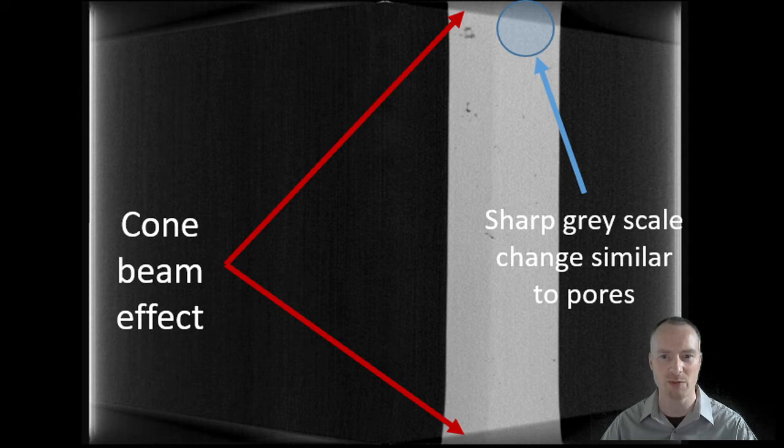The cone beam effect will be made worse as the X-ray detector moves towards the X-ray source, and it will decrease as the X-ray detector is moved away from the X-ray source. The cone beam effect causes a number of issues with post-processing. We can see here the areas which are affected by the cone beam effect have a darker grey pixel value. These are very similar to the pores within the component which we are trying to analyse. So separating these during the segmentation stage will be very difficult.